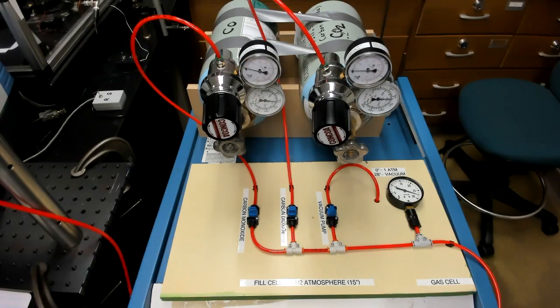All right, the last thing we'll do is to take a spectrum of carbon dioxide by filling the cell with carbon dioxide and repeating our measurement. Okay? Of course, we have some data on carbon dioxide already because of the stray CO2 that got into the other files, but let's try and do it carefully.